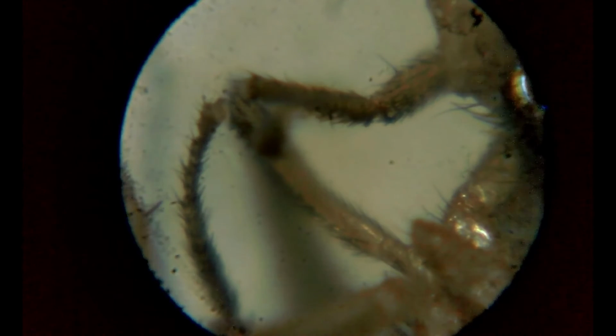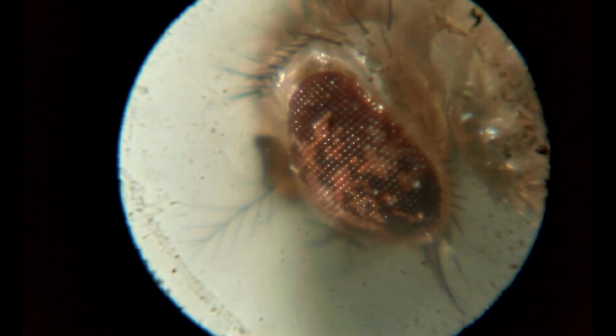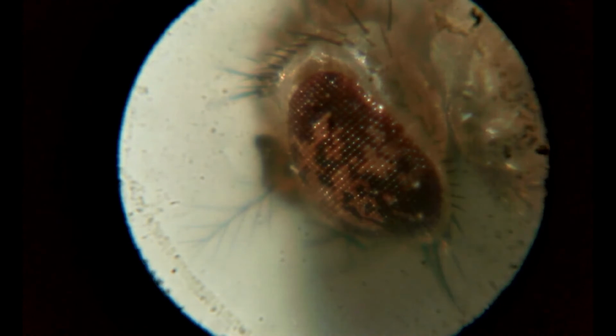This is a fruit fly. I can see very fine details such as the hair on the legs or the tiny teeth at the edge of the wings. And here is the compound eye of that fly.